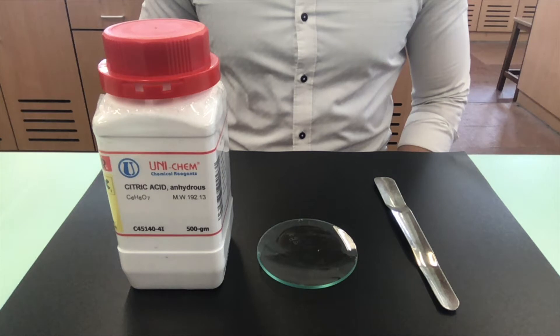In this experiment, we will show you how water plays a role in showing the properties of acids and alkalines.